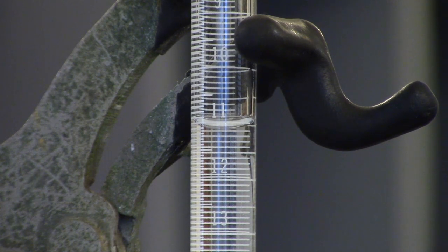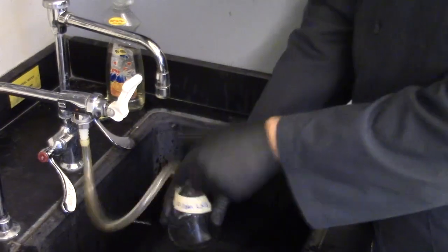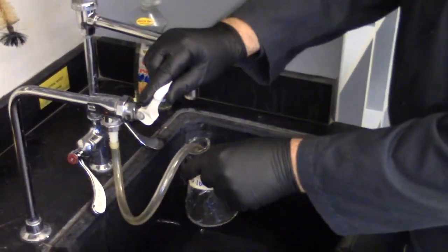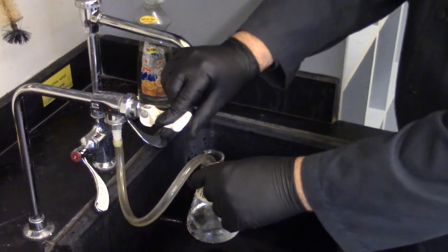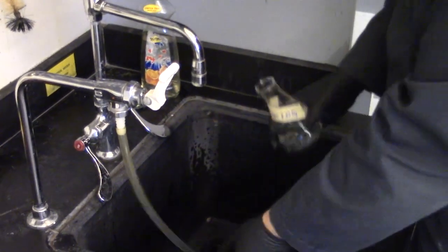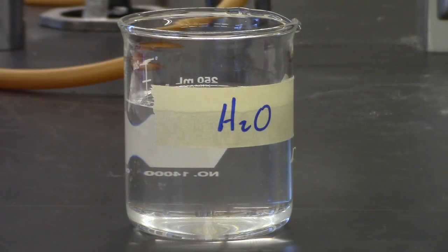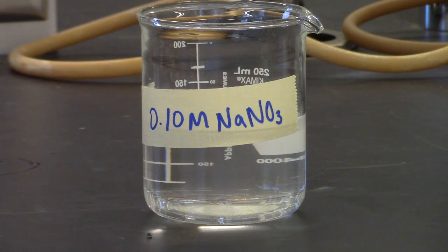Samples can be poured down the drain and rinse flasks with deionized water. You will repeat the procedures using 25.0 ml samples of the deionized water. Make sure to record the beginning and endpoints. Finally, you will repeat with 25.0 ml samples of the sodium nitrate solution.